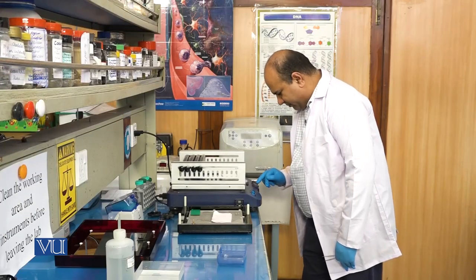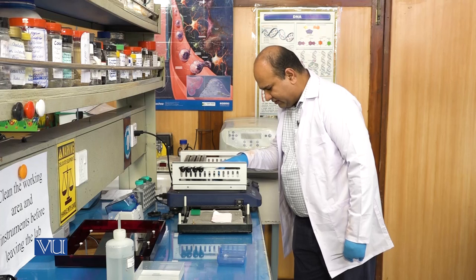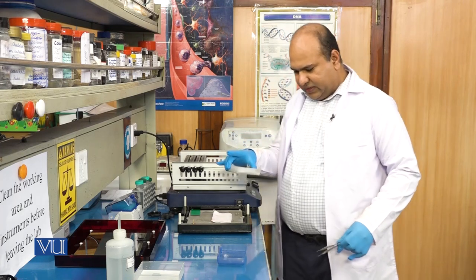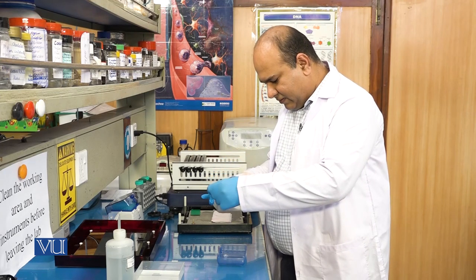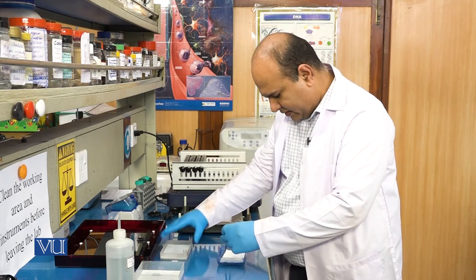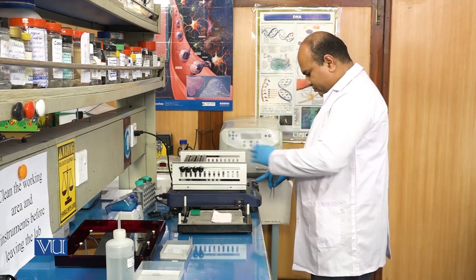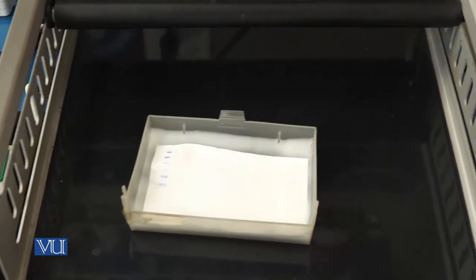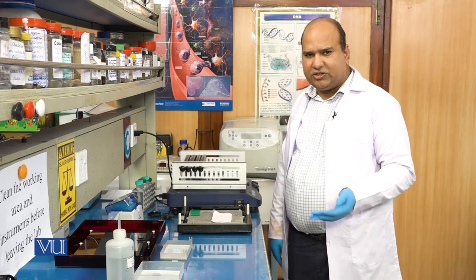Now the primary antibody step is complete. Let's take this membrane out and put it into a wash buffer. We will let it shake for 10 minutes, and you will repeat this process three times — at least 5 to 10 minutes each, depending on what sort of primary antibody you are using. After washing it three times, we will add a secondary antibody.